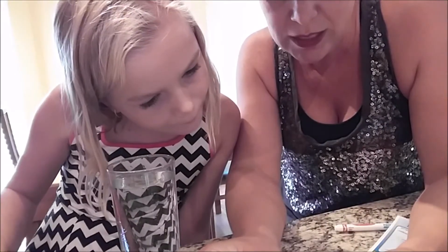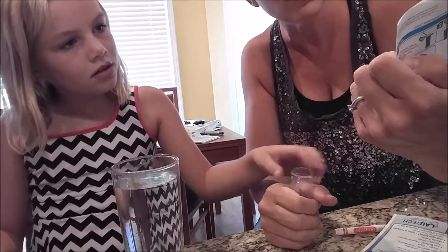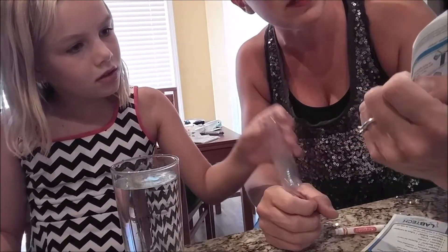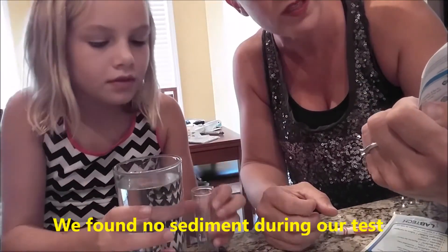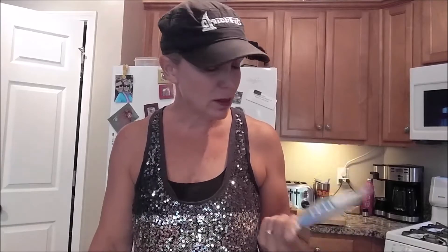Fill a clear glass with cold water. Allow any sediment to settle at the bottom. If the sediment has a feathery appearance, iron bacteria is present. If the sediment has a rusty powder, iron bacteria is not present. One other thing this test mentions is the presence of hydrogen sulfide in your water — there's no test strip for it. You just look for that rotten egg smell, and apparently that means you have hydrogen sulfide in your water. This doesn't say whether hydrogen sulfide is harmful; it calls it a nuisance.